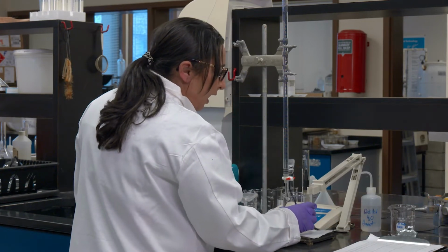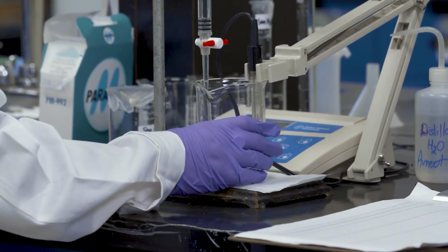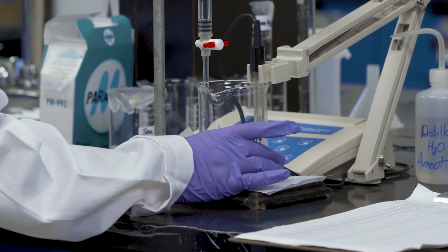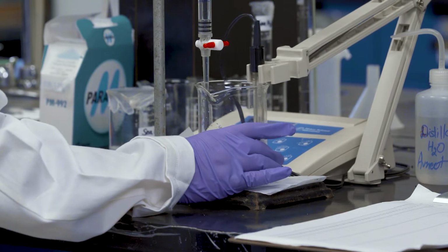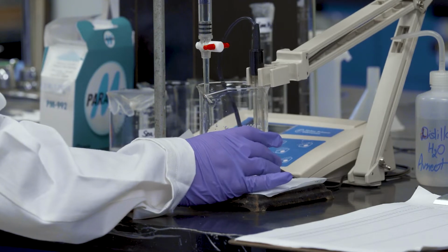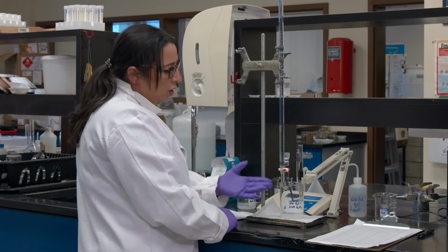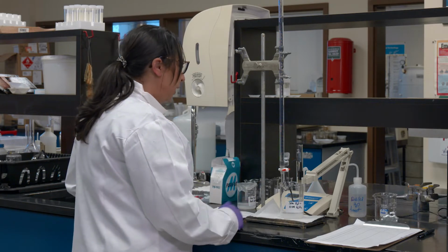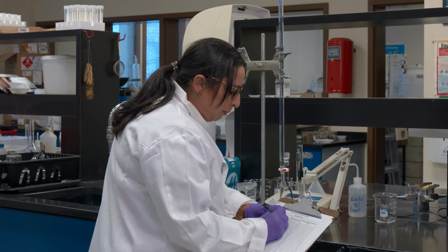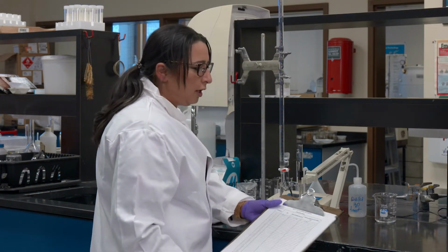And as I said, I have already prepared the solution. Just to remind you, I'm going to agitate it a little bit so that I get the initial reading. I'm going to stir it so that my carbonate is dissolved completely, as it's been a while since I added it, and make it a homogeneous mixture. Then I will wait for my pH meter to give me the initial reading before I start adding the acid to my solution. The first reading I got for my solution is 9.91, with nothing added, no sulfuric acid. So that's our starting point.